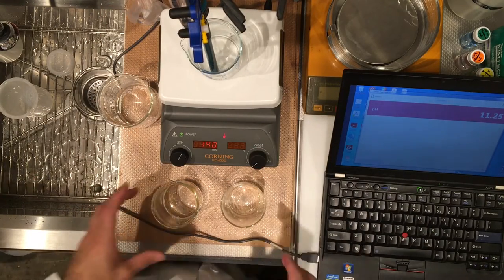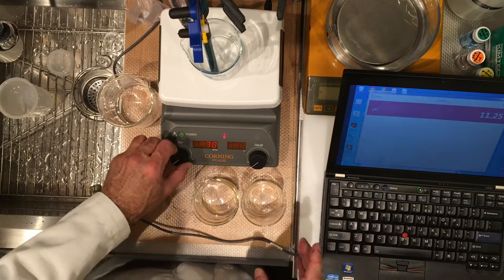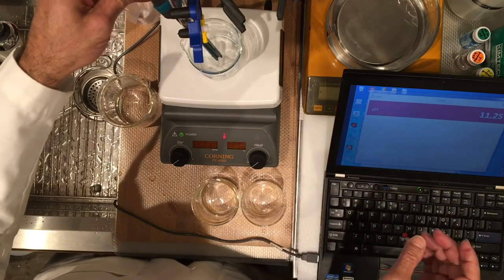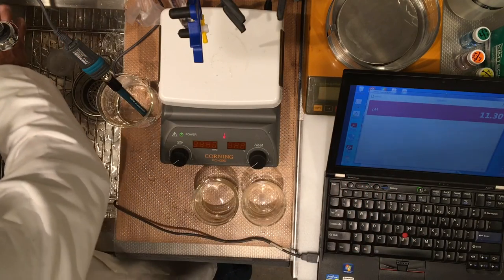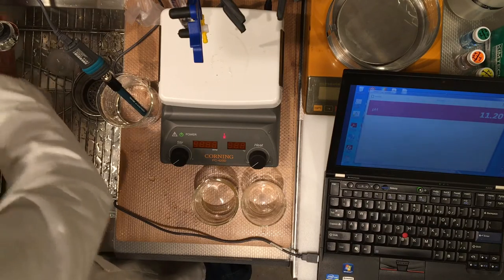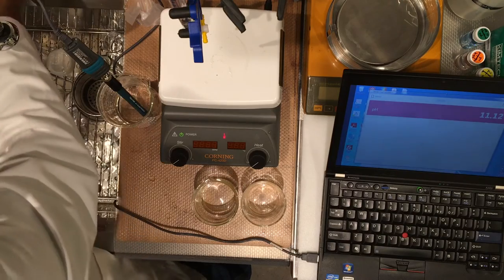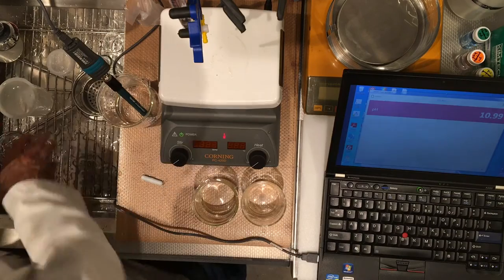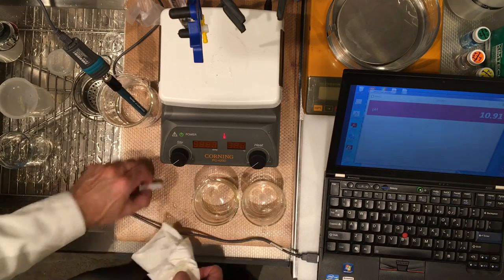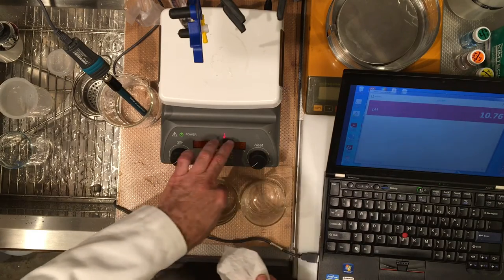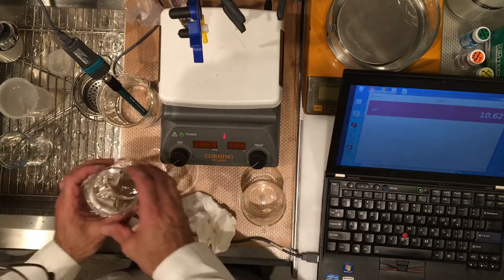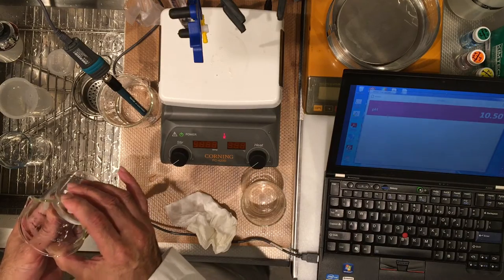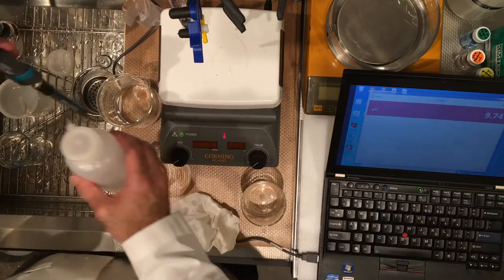So we passed the equivalence point. All right I'm going to stop this, remove my probe. Now we have our second solution, putting the magnetic stirrer in. I want to put the probe in but I want to make sure that it's dissolved. It looks like it's pretty well dissolved so let's go ahead and measure the pH.